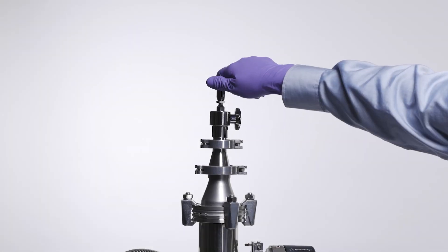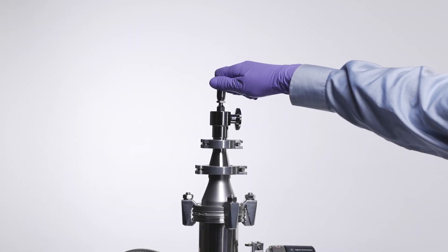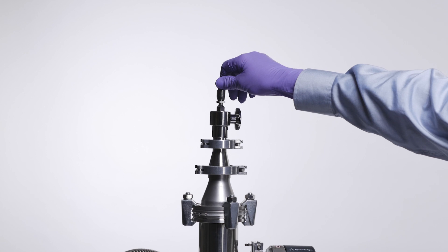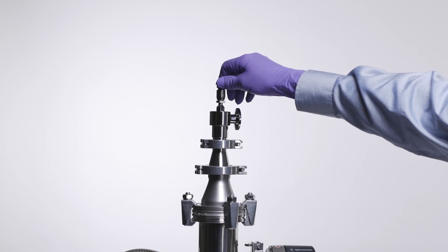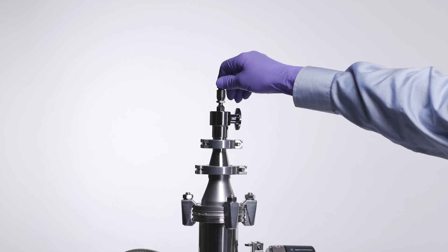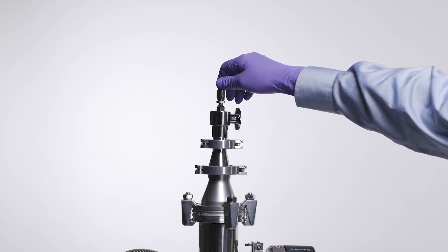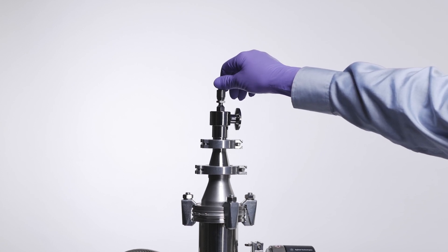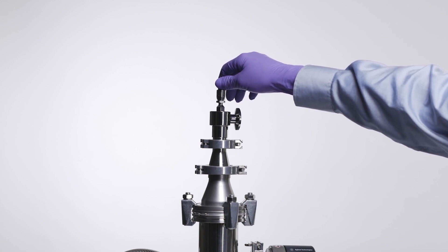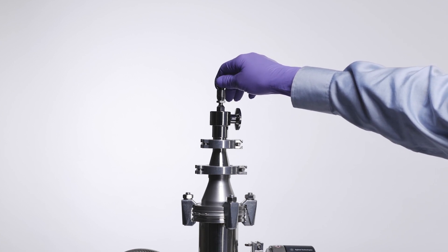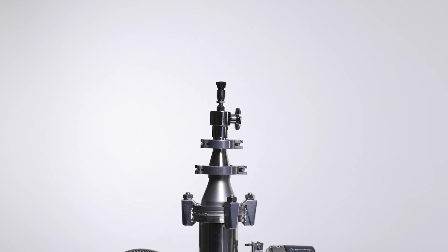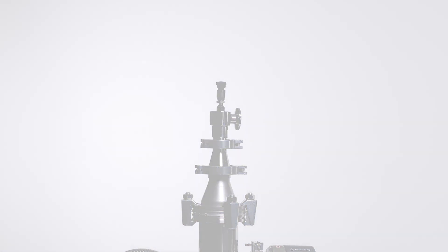With this needle valve, I'm introducing a gas load to the system so we can see the effects on the pump parameters. I'm not using a flow meter so I'll just monitor the pressure and increase the gas flow until the pressure stabilizes in a higher pressure range.